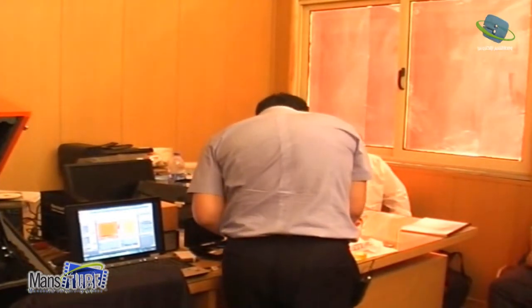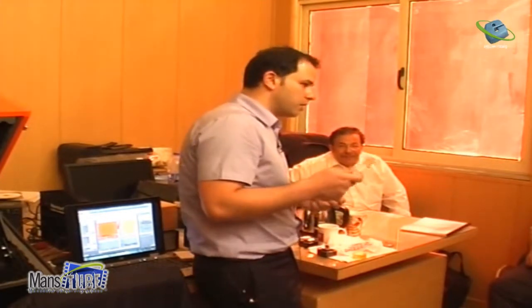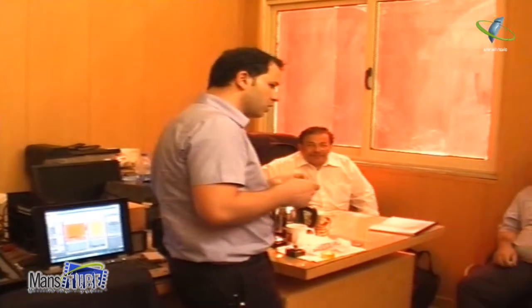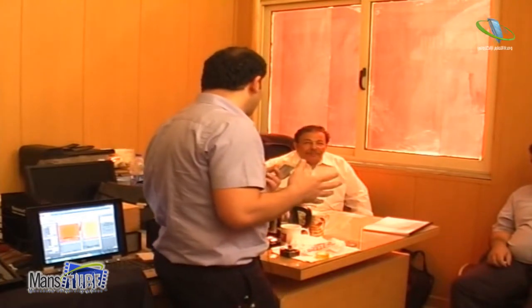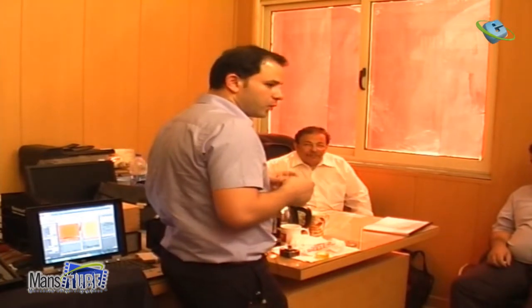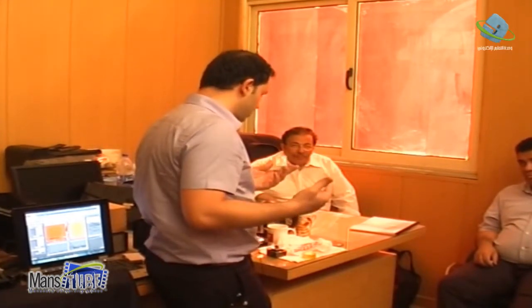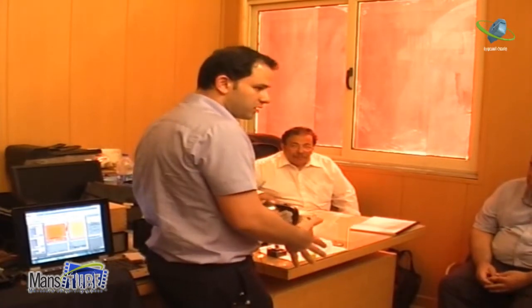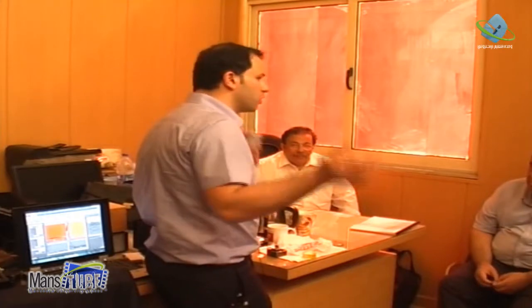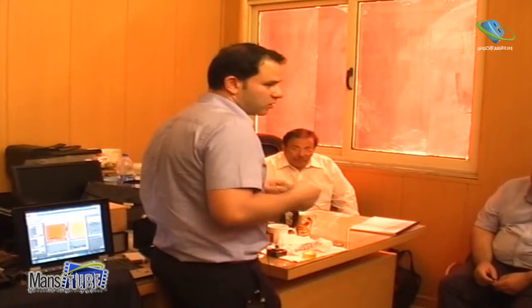So I will take a dynamic cantilever. Usually, for minimum optimal results, you use a cantilever coated with gold, because gold is inert and in liquid does not have any reaction. This one has aluminium, and usually aluminium is not stable. But for what we want to do now as a basic, it is okay. If you want to work all day in liquid, then it's better to have a cantilever with gold coating.